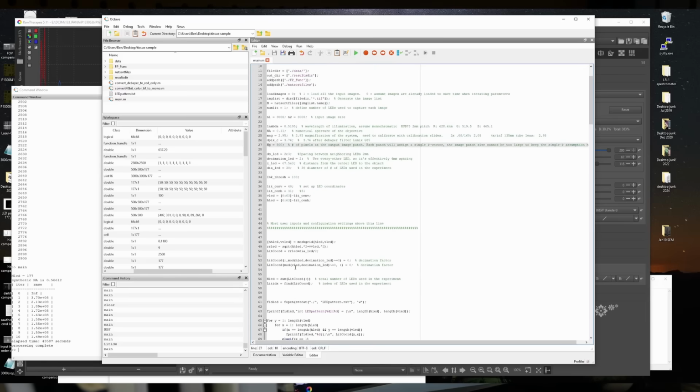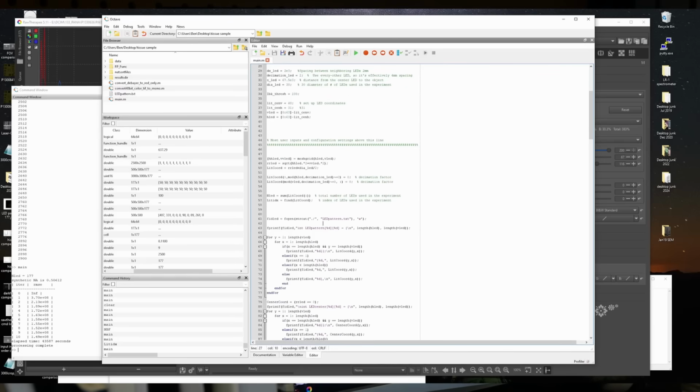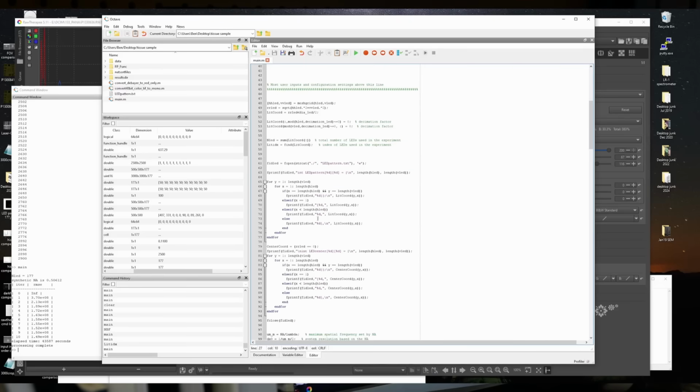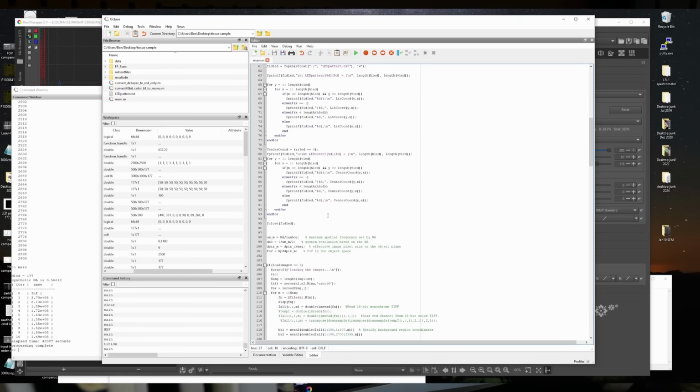So I added this way of keeping track of which LEDs need to be illuminated. And I came up with this idea of making a text file that has a C array, like an array defined in the language C, that we can pump into the Arduino script, and then it can cycle through those to light up all the LEDs. So it prints out this array that you can copy and paste into your C code, into the Arduino code.